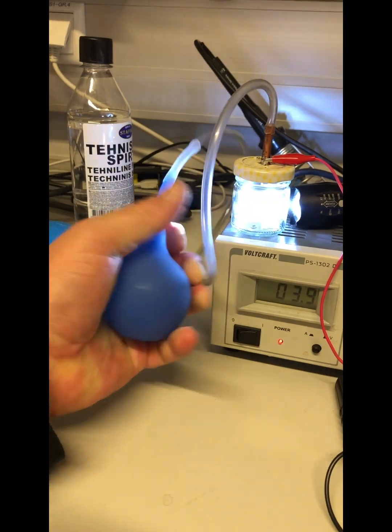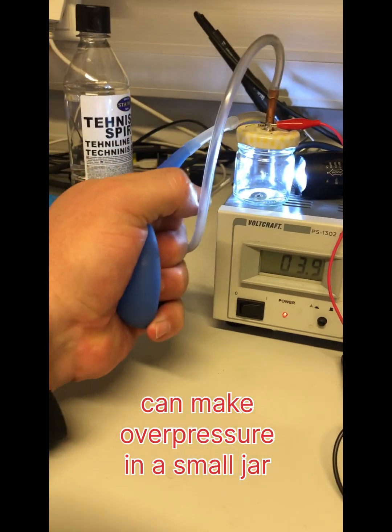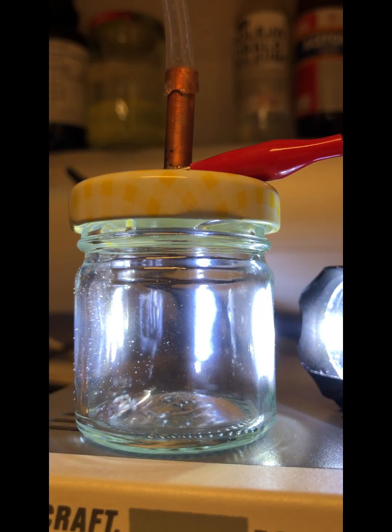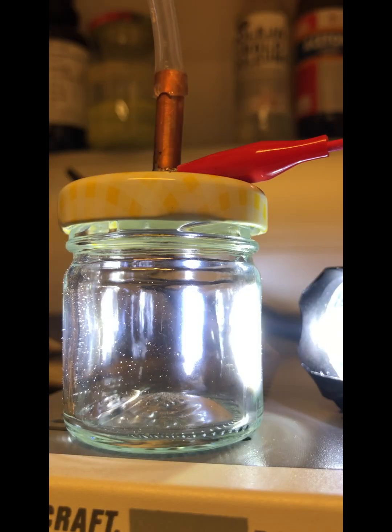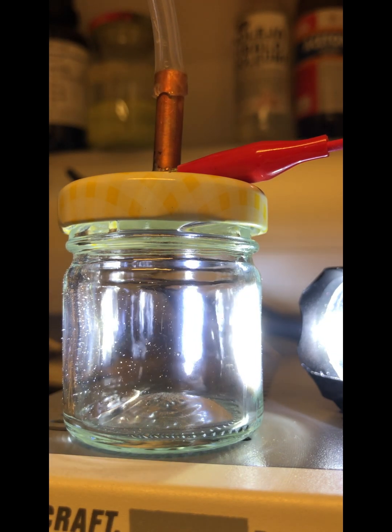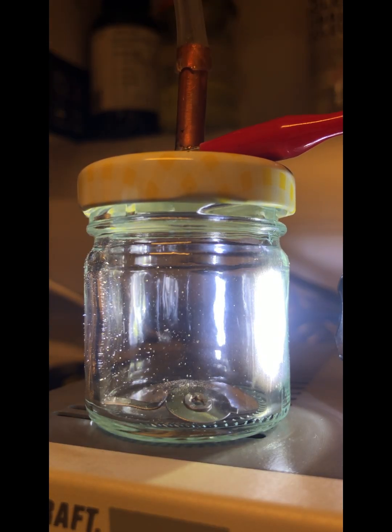Could not get it running with a small rubber ball. I was venting many times and now start to see tracks, so the concentration was too high. Pumping many times to make equalization, then waiting 5 seconds and drawing quickly. Nothing. It's so complicated to get tracks. Don't try it at home.